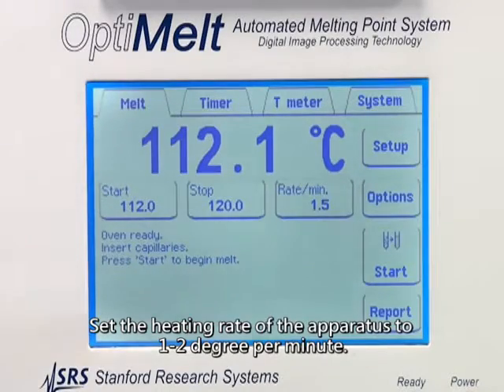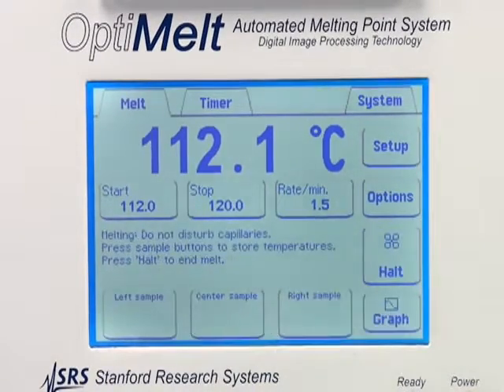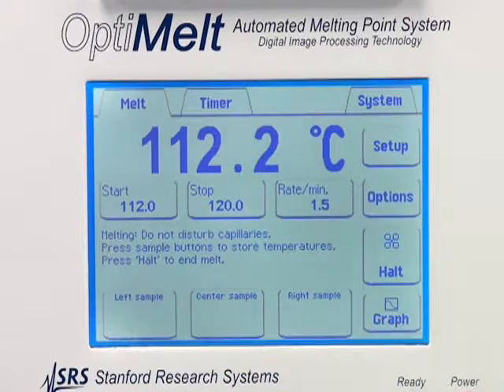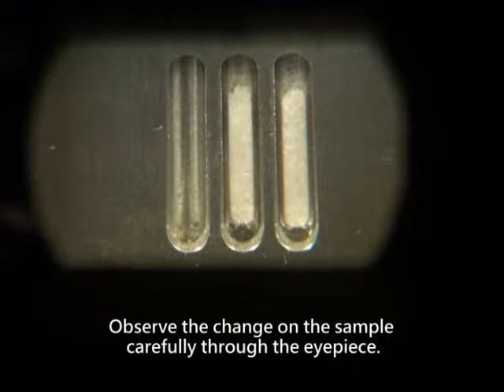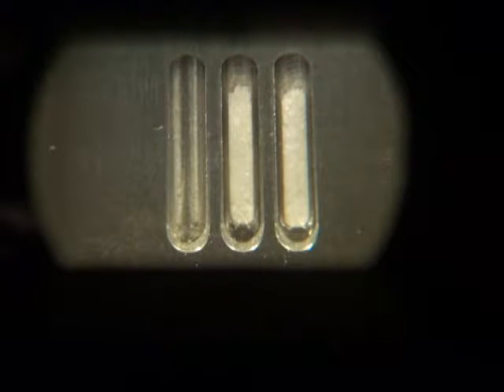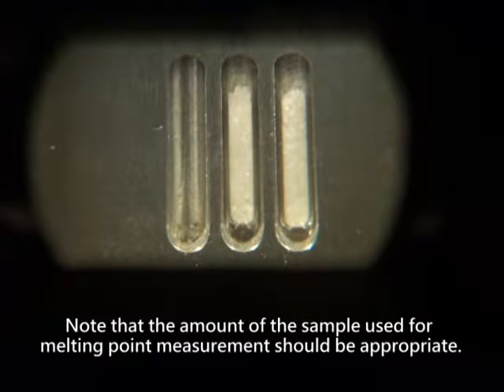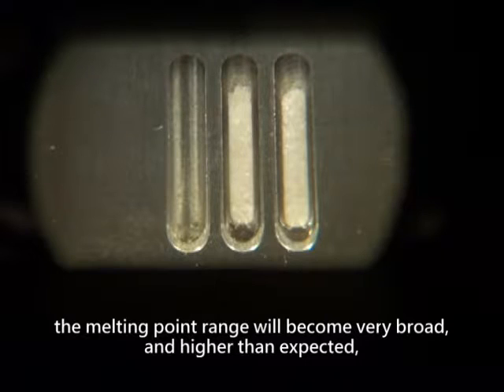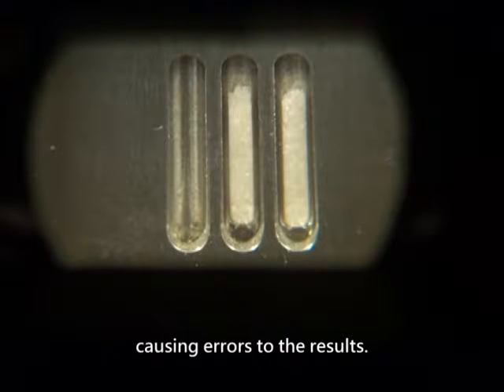Set the heating rate of the apparatus to 1 to 2 degrees per minute. In the demonstration, the heating rate is set to 1.5 degrees per minute. Observe the change on the sample carefully through the eyepiece. Note that the amount of the sample used for melting point measurement should be appropriate. If the capillary is packed with too much sample, the melting point range will become very broad and higher than expected, causing errors to the results.